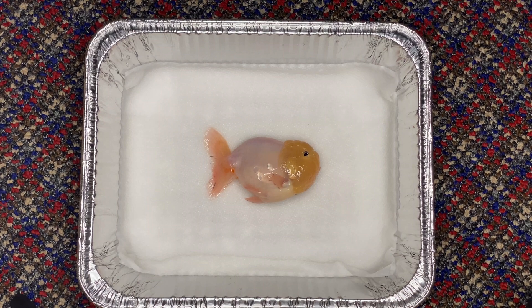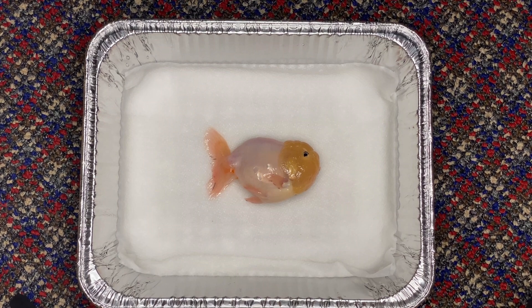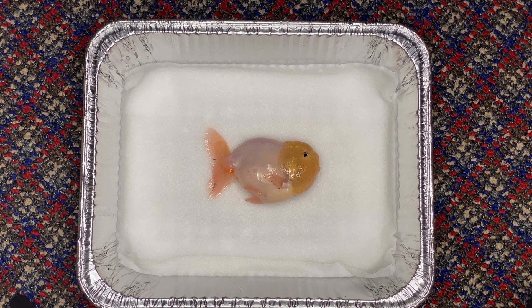So that's basically all I wanted to show. There are other parts of the goldfish, but I think you guys have got a good enough idea of where these organs are and their placement. The main reason for this video is if there's an experienced fish keeper out there who really wants a good idea of the placement of the swim bladder and where to approach a swim bladder procedure. You really want to go basically right behind the head, angled toward the back, with the needle entering kind of right behind the head. That's where you're going to find the best access to the swim bladder.